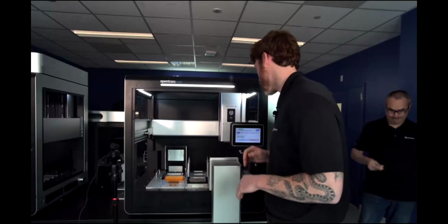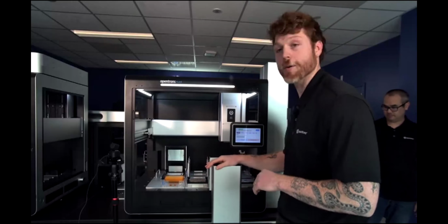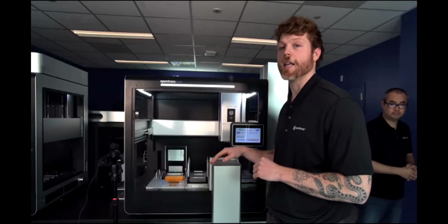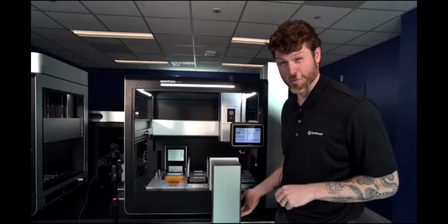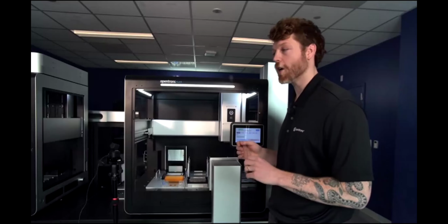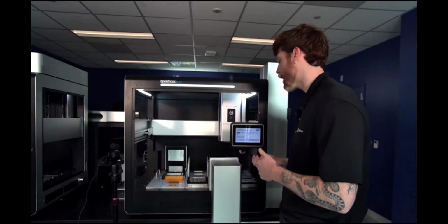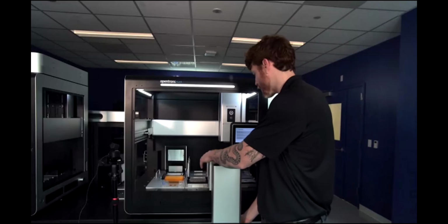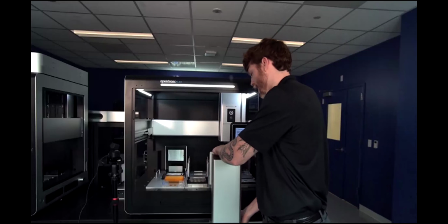Okay, so first thing I'm going to do here so that we can see what's going on a little bit better is that we have a waste chute on the front of the instrument. This is typically bolted into the sides. I'm just going to remove this for today. We're going to be running more of a demo protocol, running on a loop here, so we don't actually need to throw anything away in this protocol currently. So I can just take this off.